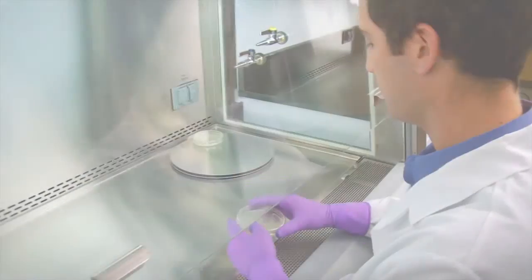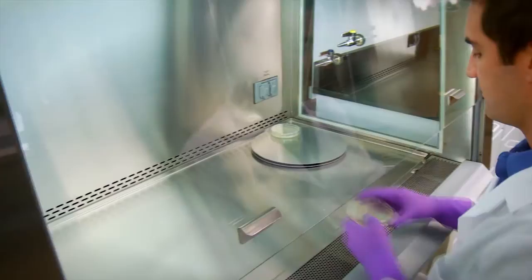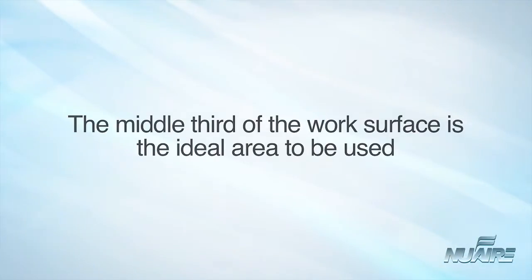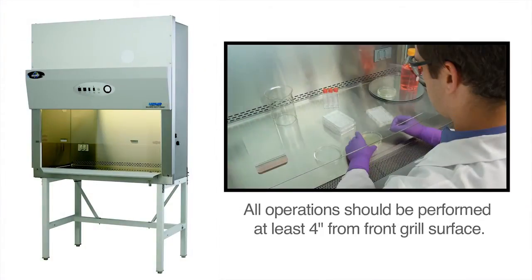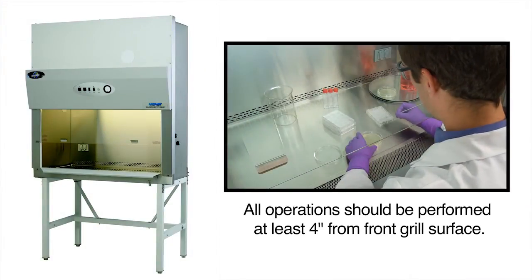Working with additional equipment within the cabinet should also be thought through carefully. The middle third of the work surface is the ideal area to be used. All operations should be performed at least 4 inches from the front grill on the work surface.